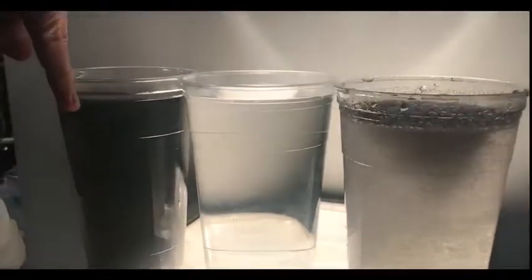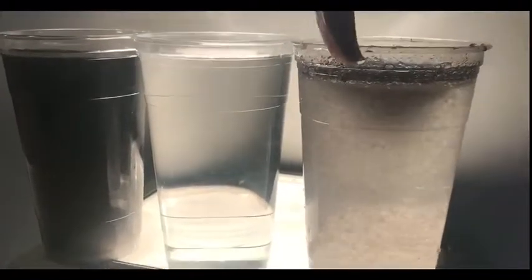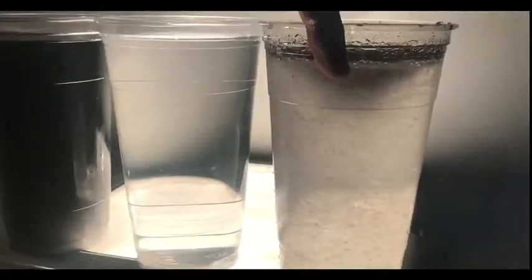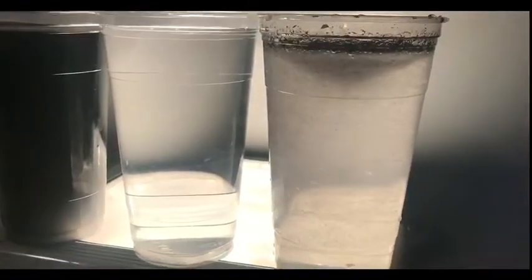This is the before water that we drew from the bucket. This is tap water, and as this separates you'll continue to see the clear phase at the bottom with the solids floating to the top.